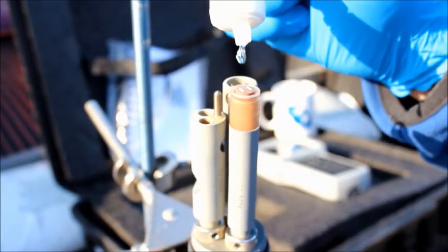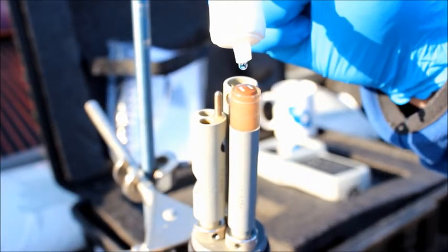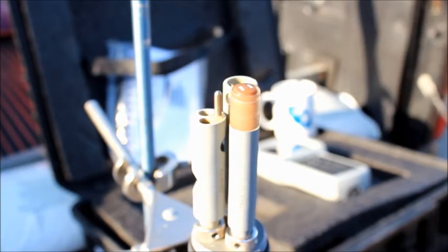Once the O-ring, membrane, and solution have been removed, the technician places drops of DO solution onto the end of the probe until there is a meniscus that is completely free of air bubbles.